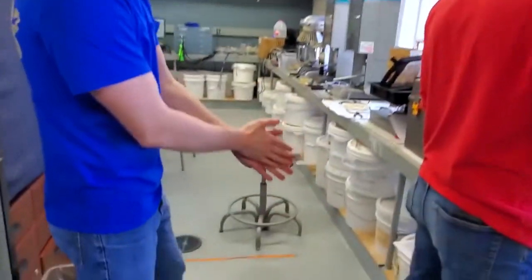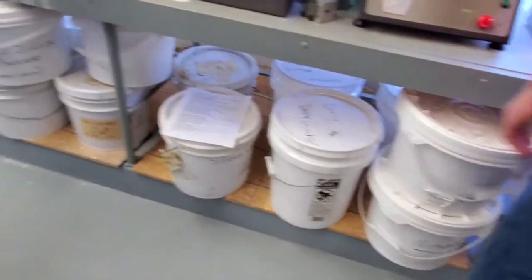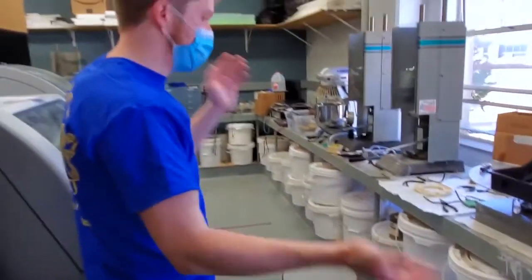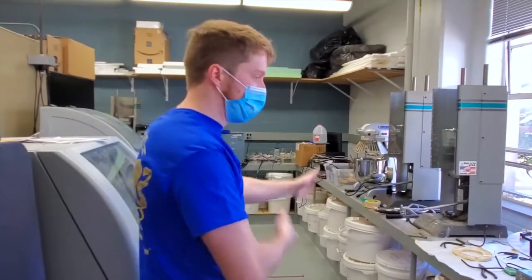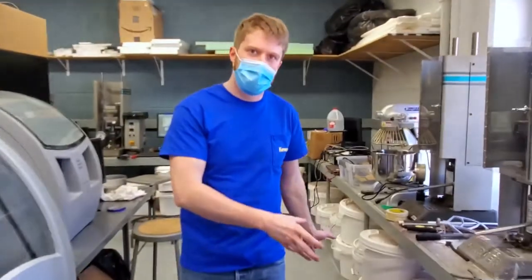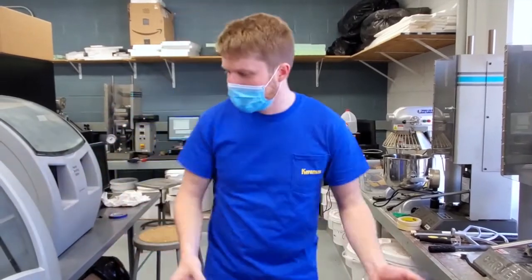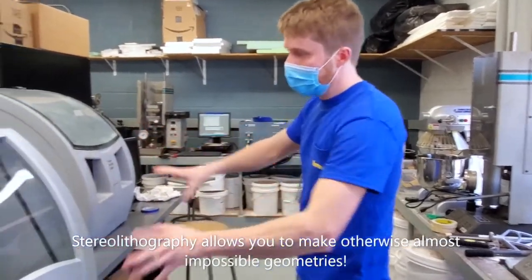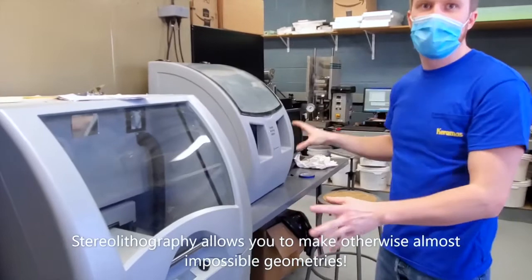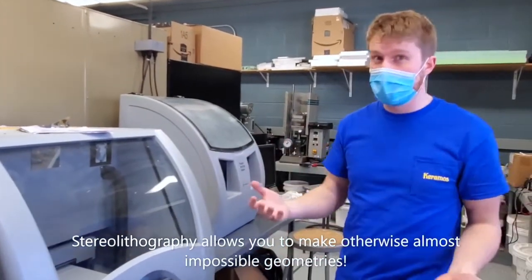Down here are a mix of all different types of powders. This is for making different sorts of ceramics and different sorts of molds for pouring metal into. What powders you use depends on the application of what you're going to be pouring and using, but they each have their own advantages. This is a really cool thing. This is actually a ceramic 3D printer. It's a type of inkjet printer, and it uses stereolithography.